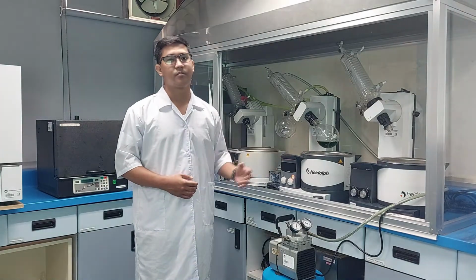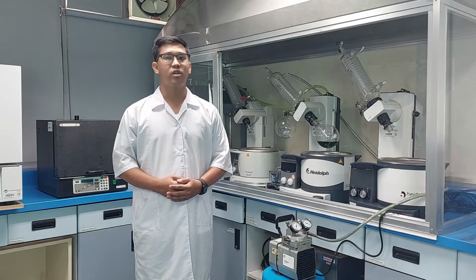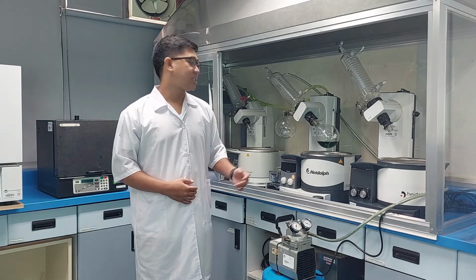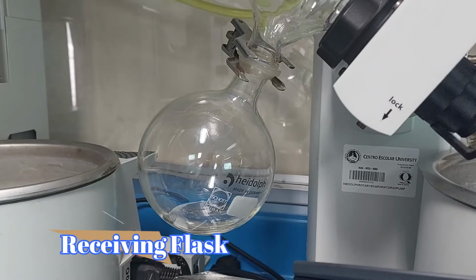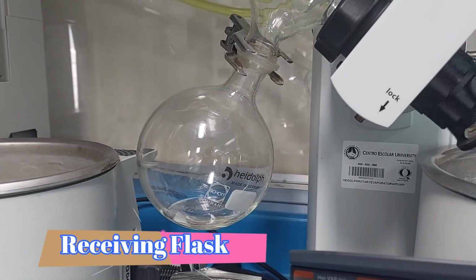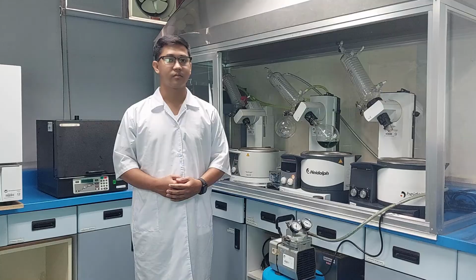Evaporation flask. There are two functions. One is to support and protect the sample when in rotating condition, and the other is to help the vacuum device to extract the sample. Receiving flask. A heavy-walled, single-neck flask with a spherical joint. Its function is receiving distilled samples.